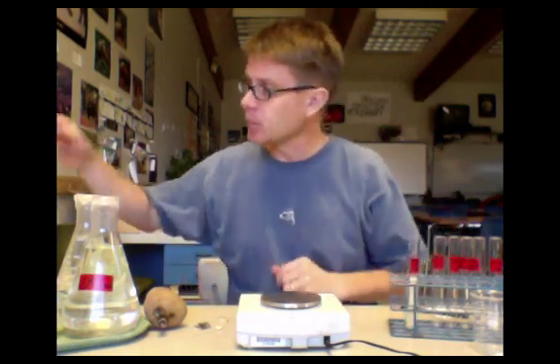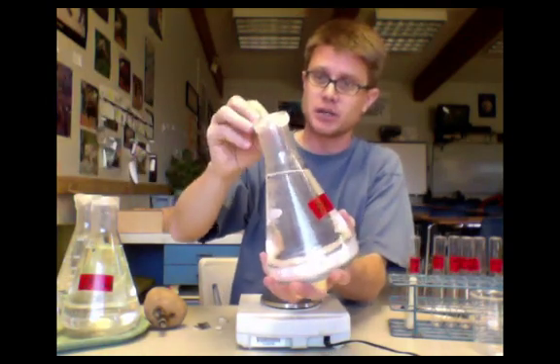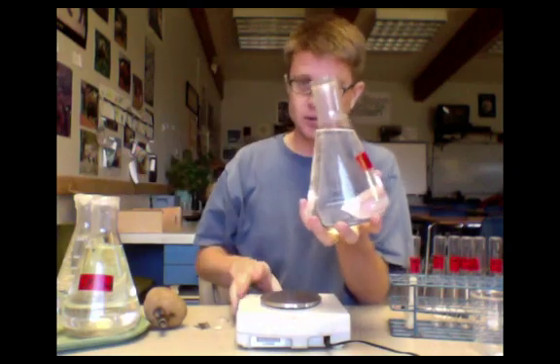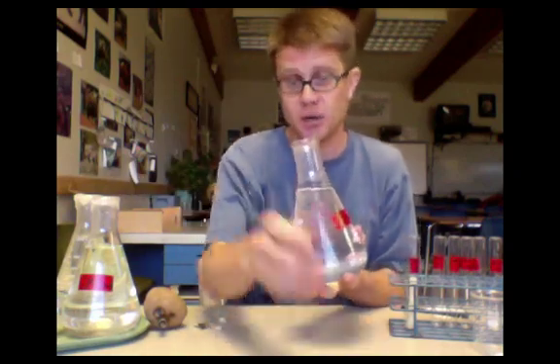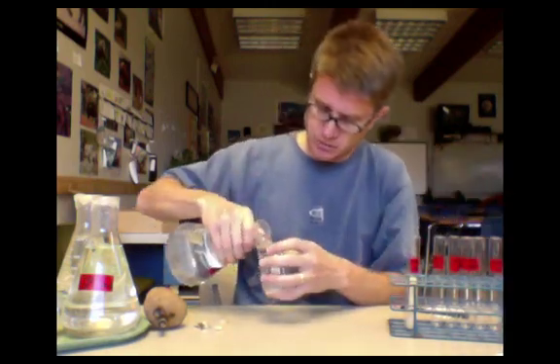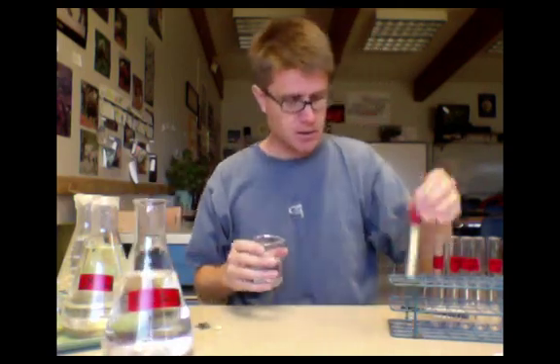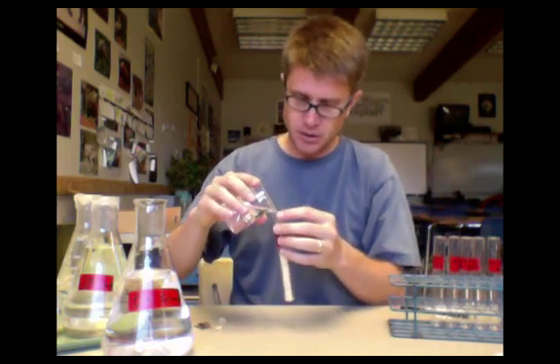Now I'm going to add some of that distilled water. There's some parafilm on the top. Make sure that goes back when you're done, because we'd hate to have us lose water so evaporation could screw us up. You're going to use the corresponding beaker and then we're going to fill it up.